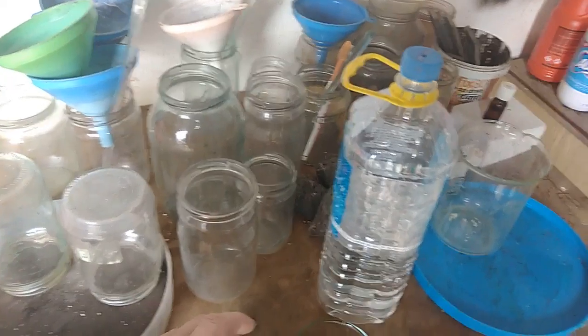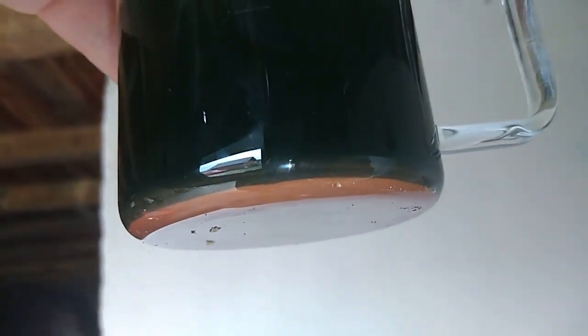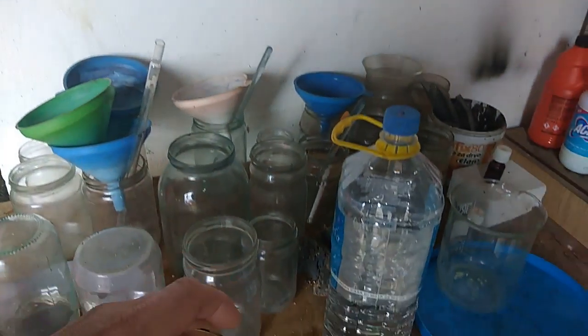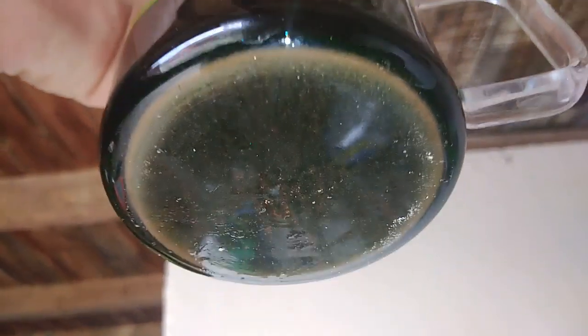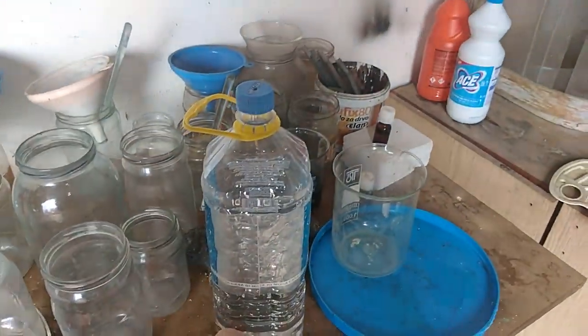Let's see this little one — yeah, I have some deposit, and this is for the magnetic. You can see that from the first solution I have some deposit, and on the second solution, well, just a little one, but nothing too much.